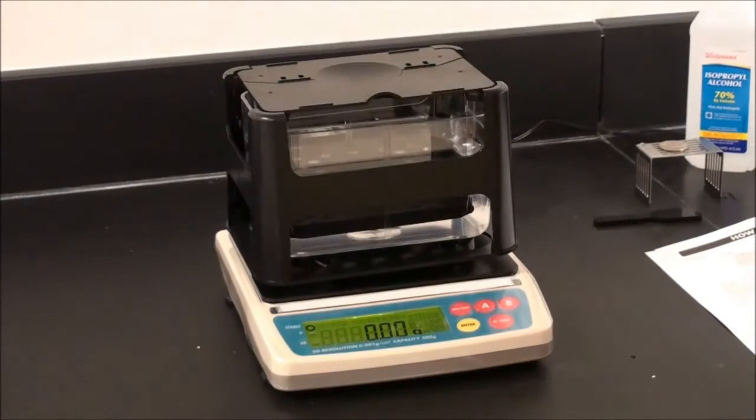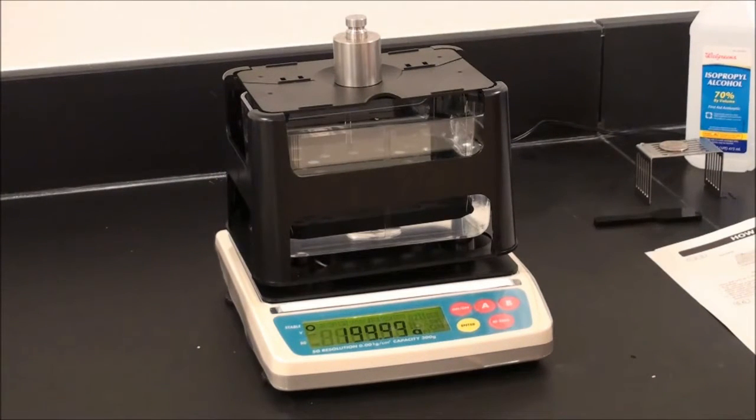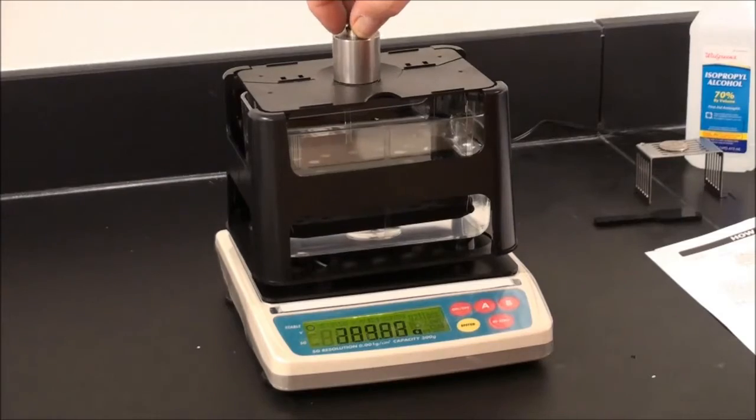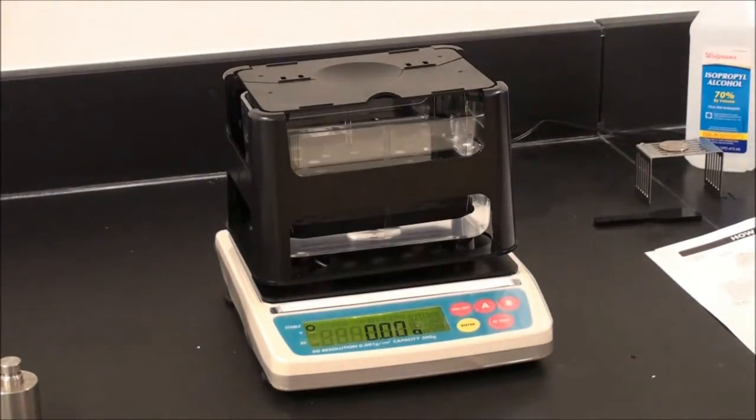You can check calibration by applying the weight, then remove the weight. We're now ready for operation.